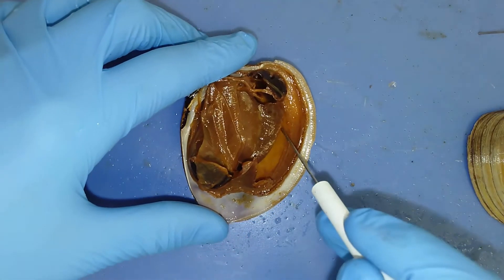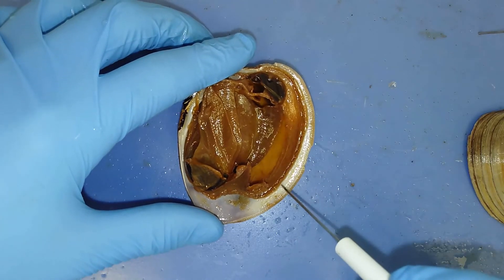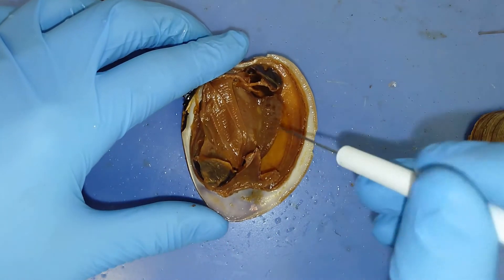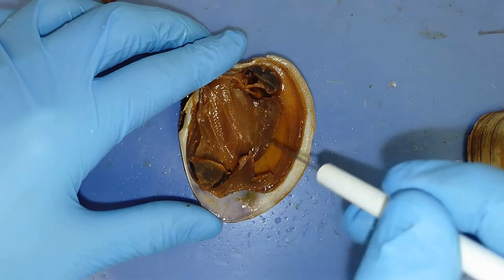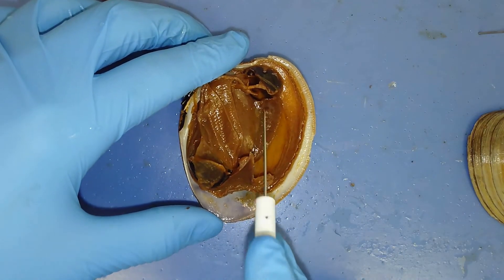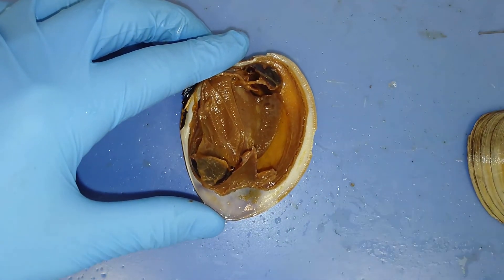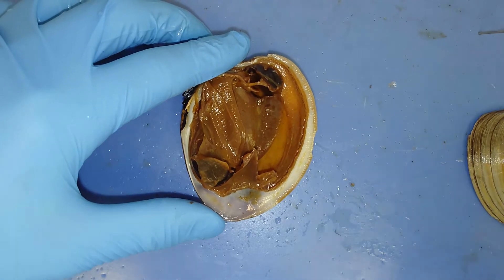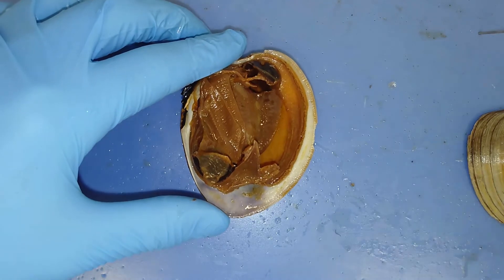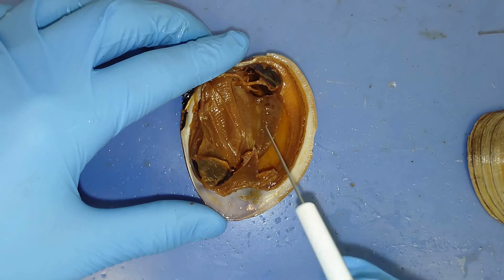This foot acts in a way where the muscle can actually move around with it, so it serves a locomotive purpose. It also can be modified in some species to look like a fish. They'll take that lure — called a glochidia lure — put it outside their shell, and undulate it in hopes of attracting a larger fish. That larger fish will strike the lure and get trapped in the shell, where the individual will release glochidia larvae.